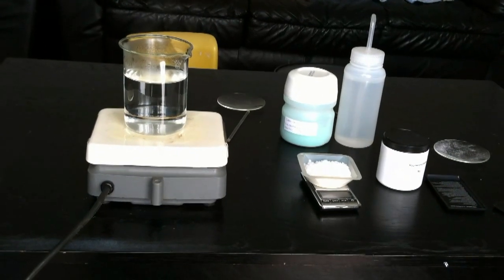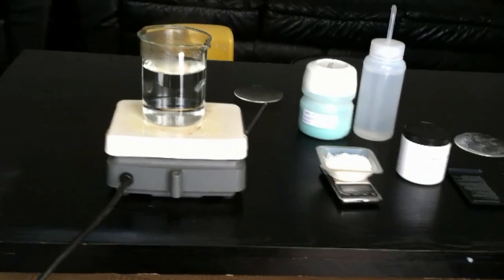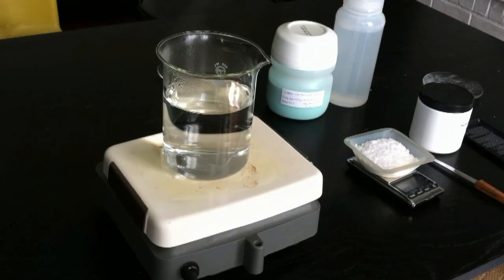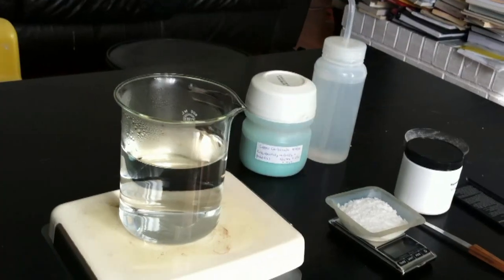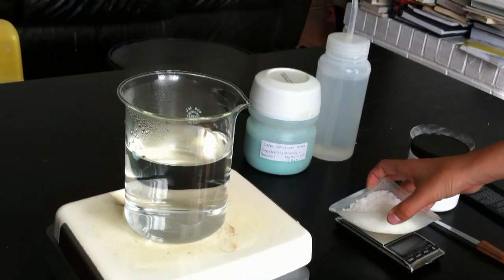Dissolve the benzoic acid into about 400 milliliters of distilled water. Benzoic acid is almost insoluble in water at room temperature but soluble in hot water. I'm going to be pouring this benzoic acid into the distilled water.